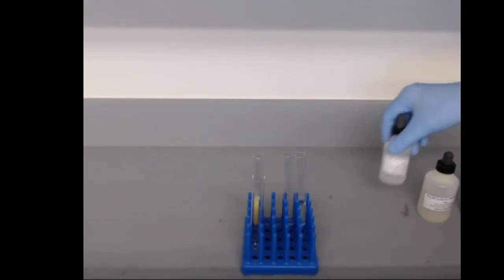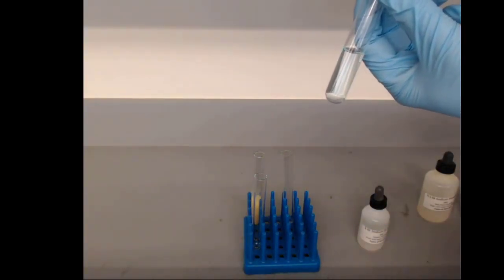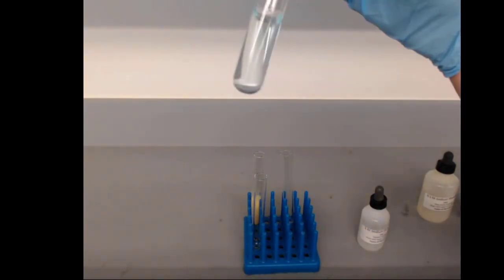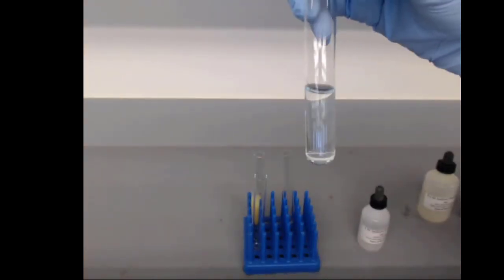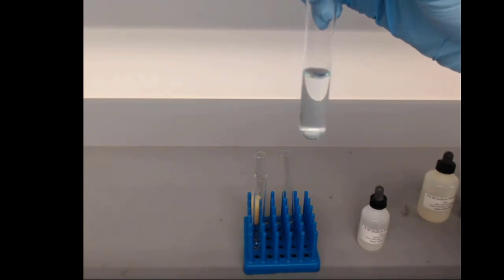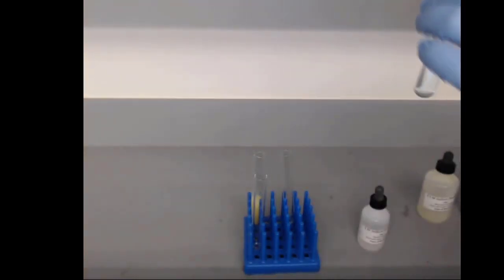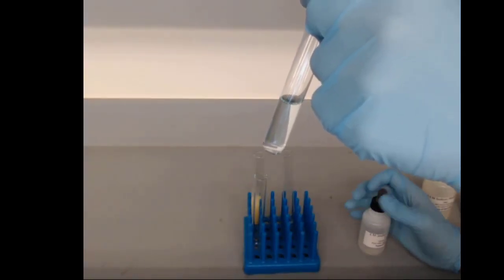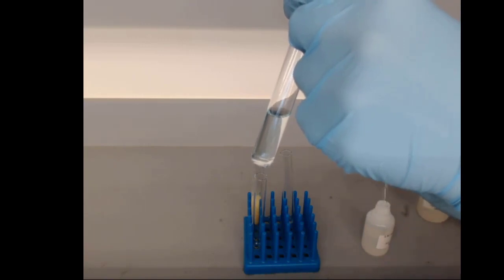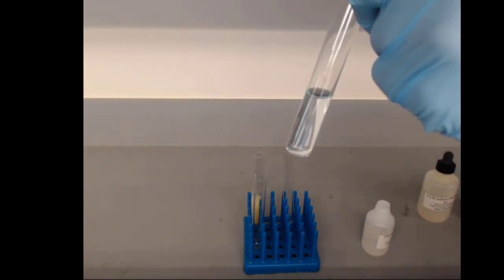Our second reaction is the copper chloride. Copper is an interesting solution. It has this faint blue hue to it. That is from the way that copper behaves in water, copper ions. And to that, we're going to add carbonate, particularly sodium carbonate, but according to our net ionic equation, the part that matters is the fact that carbonate's going in.